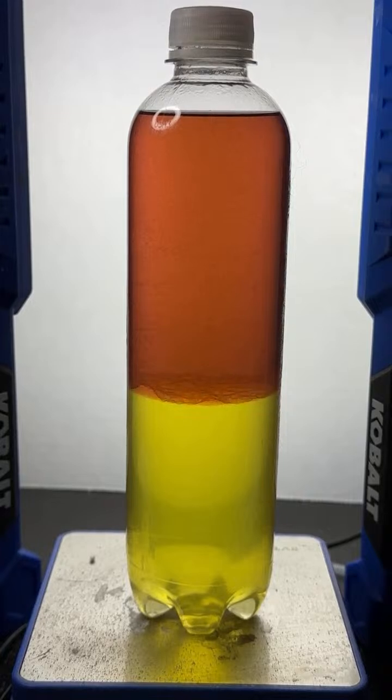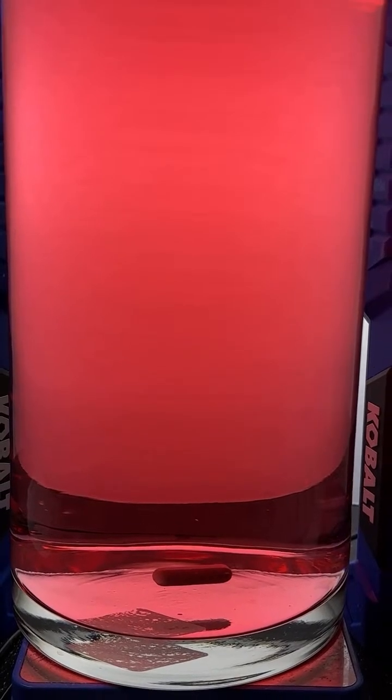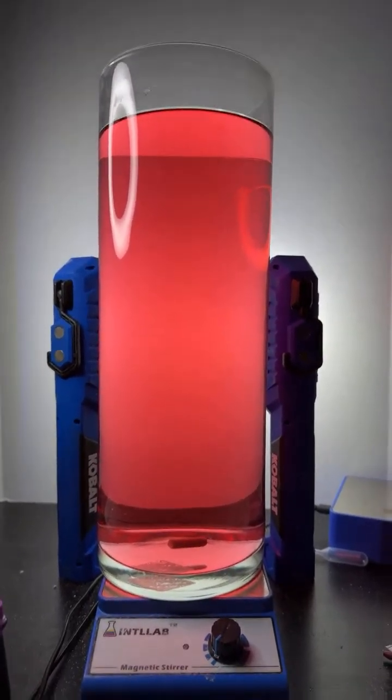All right, let's get back to our original experiment for a little bit. It does look a little bit like a watercolor. We'll get back to our original experiment here. Bear with me a second, I've got to lift up this rather large container. Here it is. It's 1.5 gallons of water. Okay, there we go. Let's get back to it indeed.